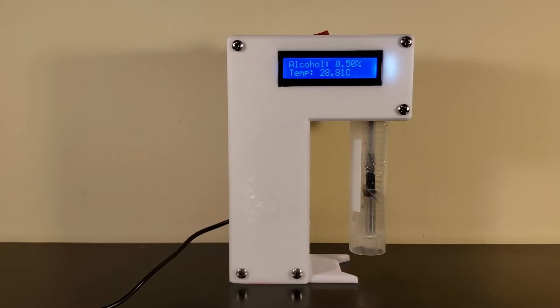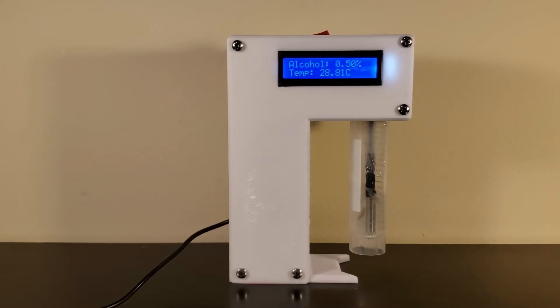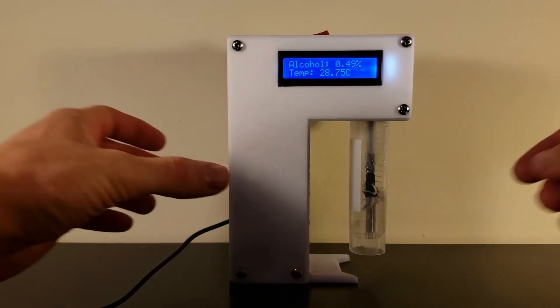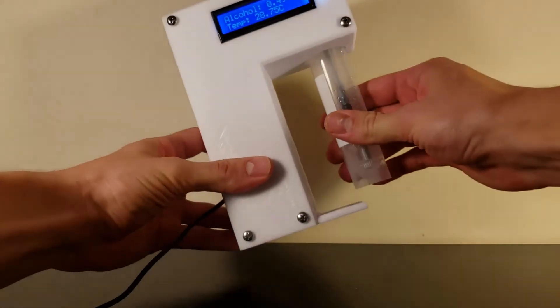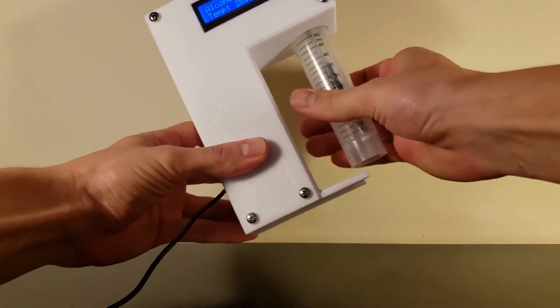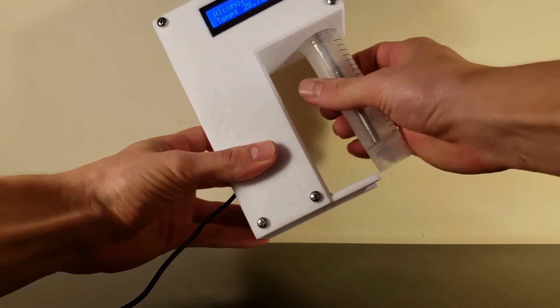Record the alcohol percentage once the temperature is reached and alcohol readings are stable. This should take between 30 seconds and 2 minutes depending on how long it takes to reach the calibration temperature. Readings longer than 2 minutes tend to fall slightly in alcohol percentage.